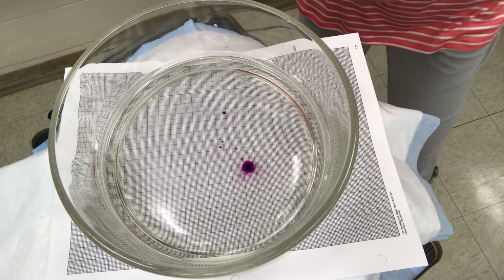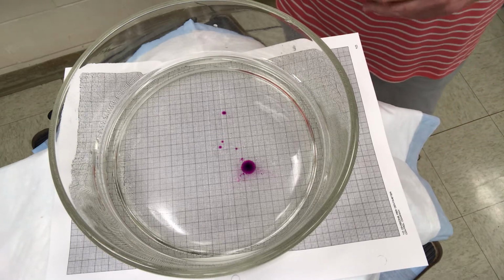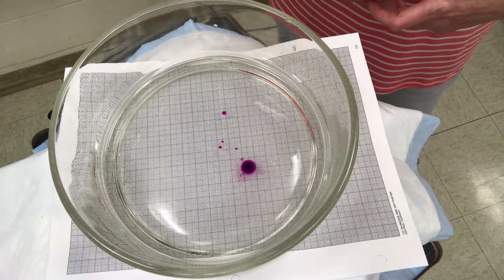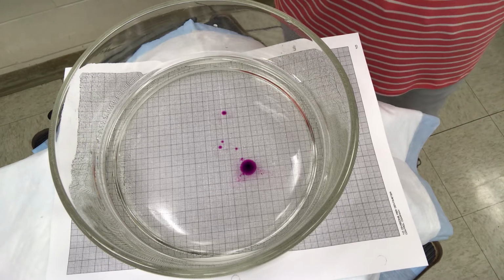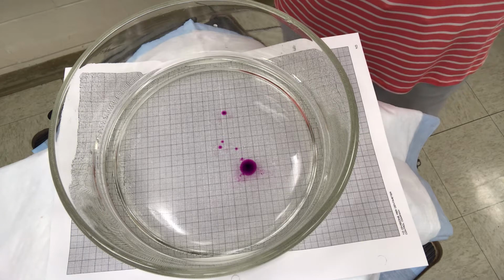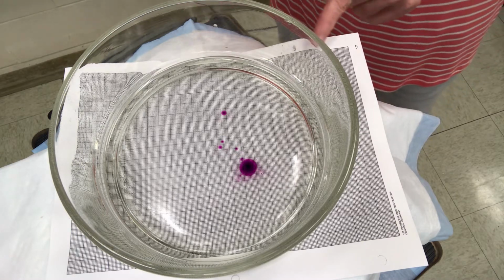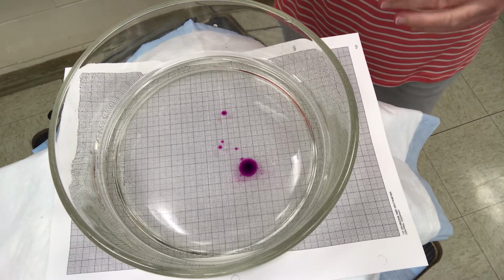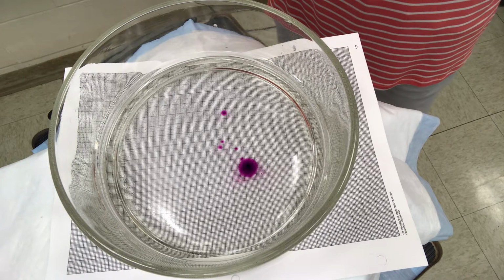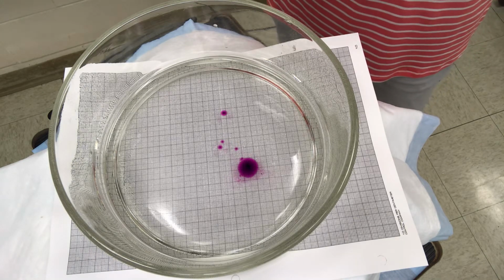Now with this medium and with the agar gel medium we're also going to look at, we're going to calculate the rate of diffusion. So with this we would measure how far it moves within a 2 or 3 minute period. And underneath the dish, we have a grid paper which is marked in dark lines for centimeters and millimeters. So we can actually measure this diffusion in 2 to 3 minutes.